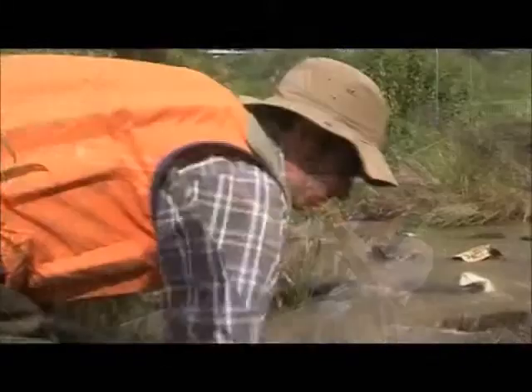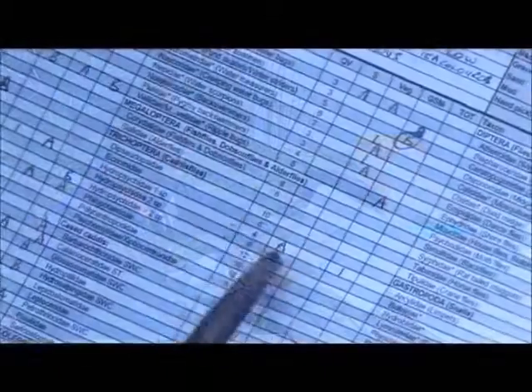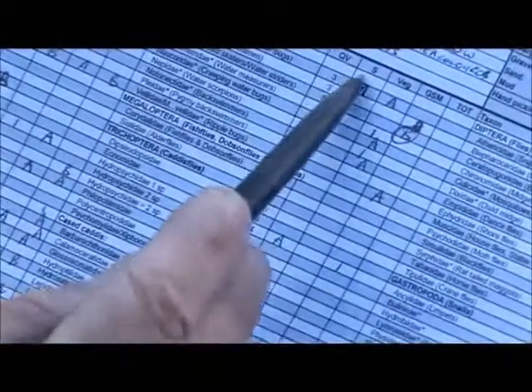Equipment, how to sample, all the way through to analysis of the methodology — to try and ensure that we have a solid, robust, standard method out there that anybody watching this production will be able to apply wherever they're working and ensure that the results reflect the health of the river and a water quality picture, rather than simply somebody's interpretation of the method which may or may not be strictly correct.